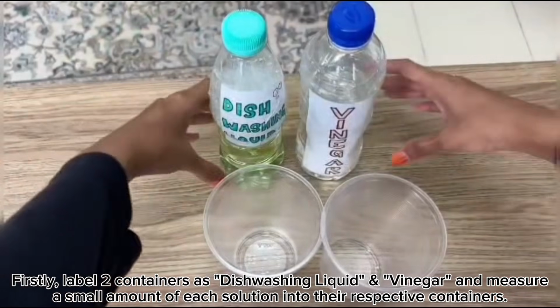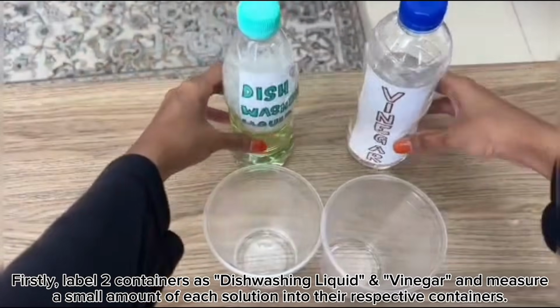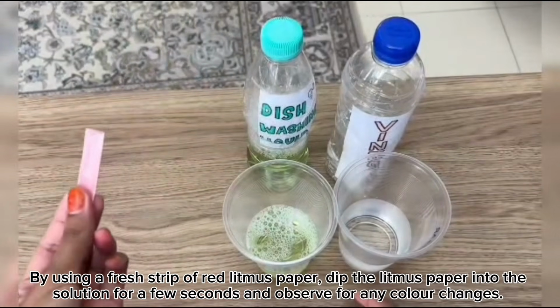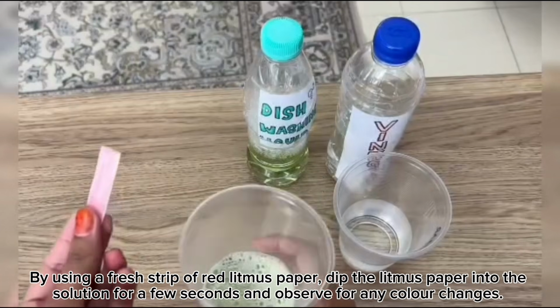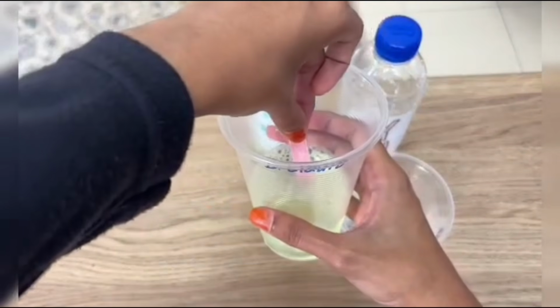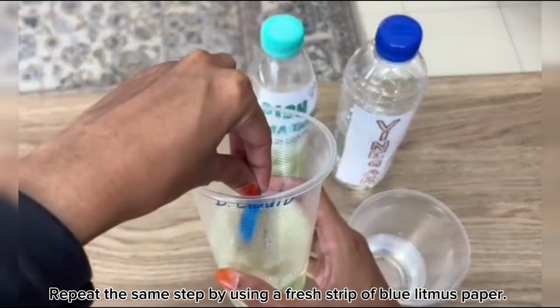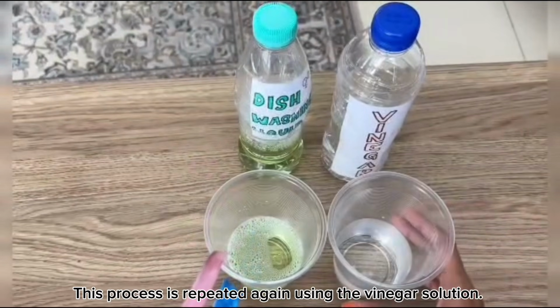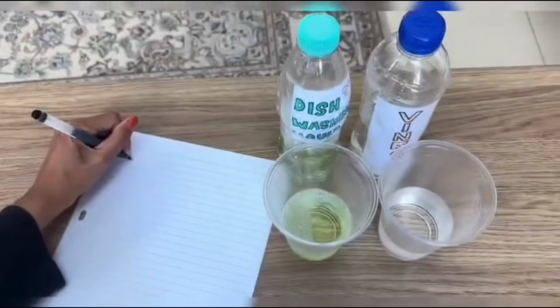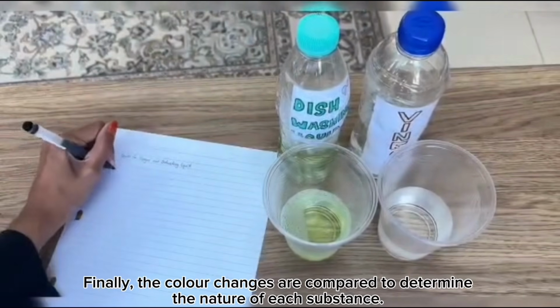Firstly, label 2 containers as dishwashing liquid and vinegar and measure a small amount of each solution into their respective containers. Using a fresh strip of red litmus paper, dip the litmus paper into the solution for a few seconds and observe for any color changes. Repeat the same steps using a fresh strip of blue litmus paper. This process is repeated again using the vinegar solution. Finally, the color changes are compared to determine the nature of each substance.